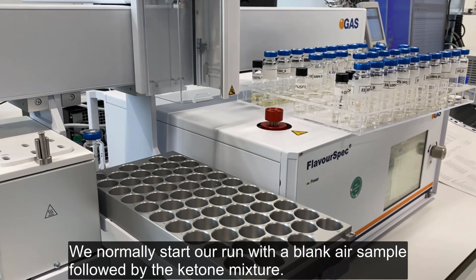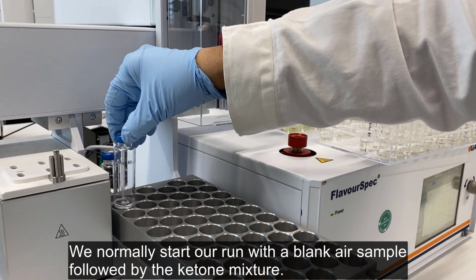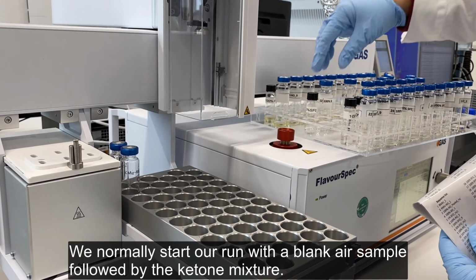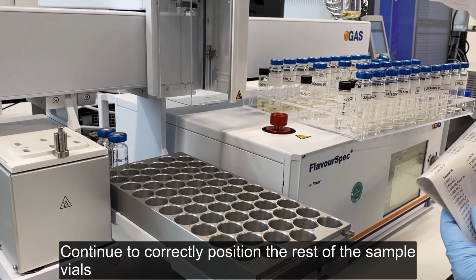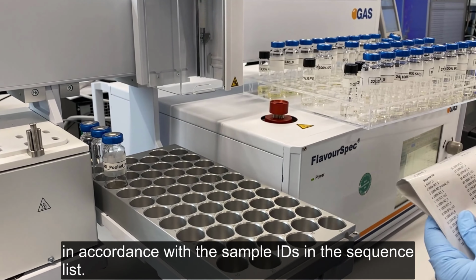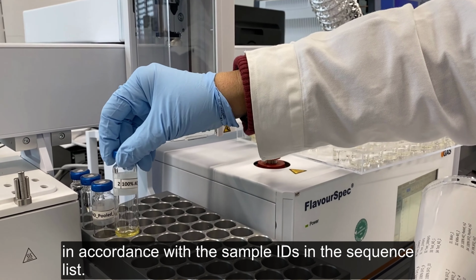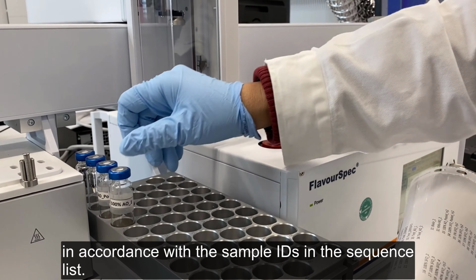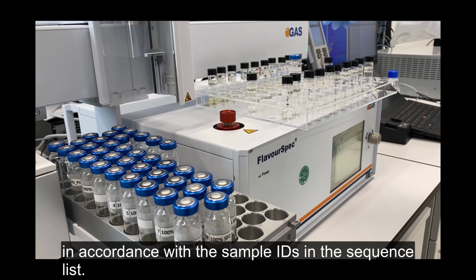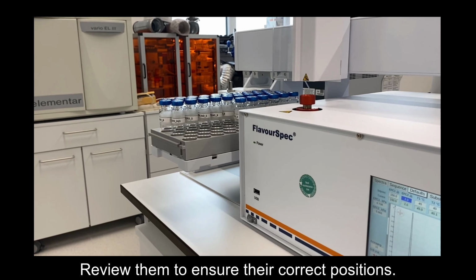We normally start our run with a blank air sample, followed by the ketone mixture. Continue to correctly position the rest of the sample vials in accordance with the sample IDs in the sequence list. Review them to ensure their correct positions.